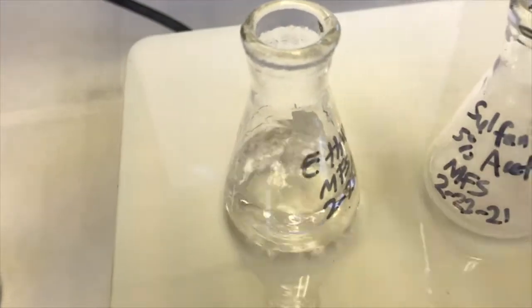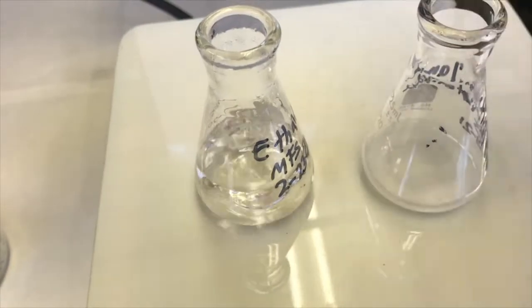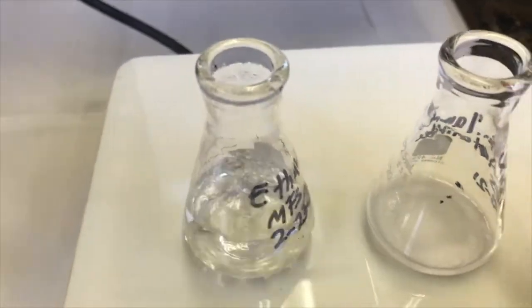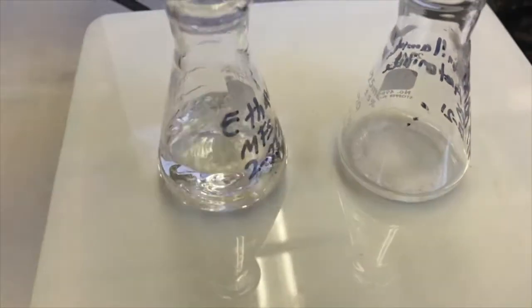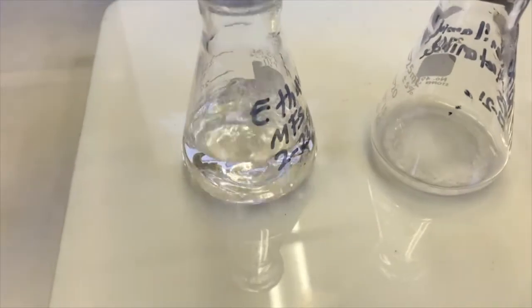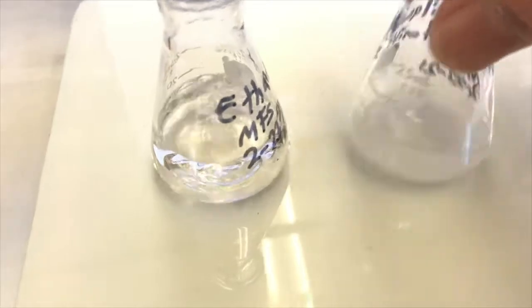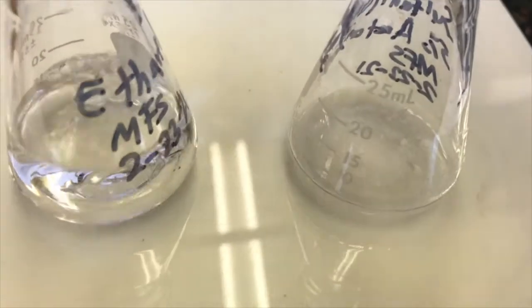Okay, so the ethanol I've added so far has already started cooling. It's not boiling. That's why I want to put it back on the hot plate, because I want to add the minimal amount of hot solvent. Got it in there, and I'll wait a little while until my crystallization flask is actually boiling a little bit, and the actual impure solid acts like boiling stones for it. And then I can swirl it around a little bit. It looks like I've still got quite a bit of solid left, so I'm going to add more ethanol.